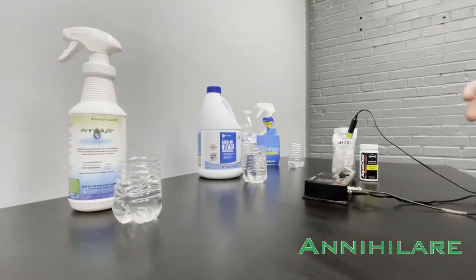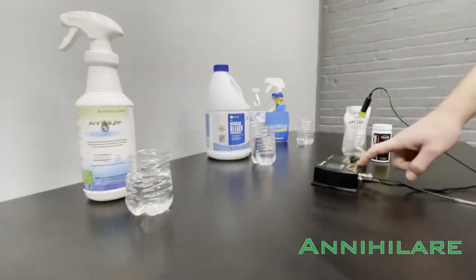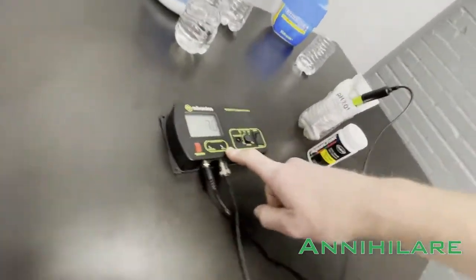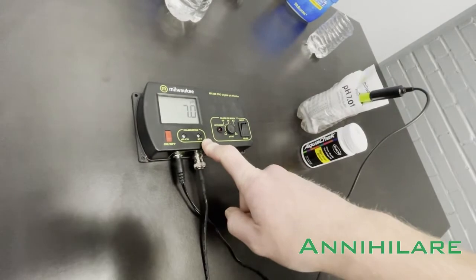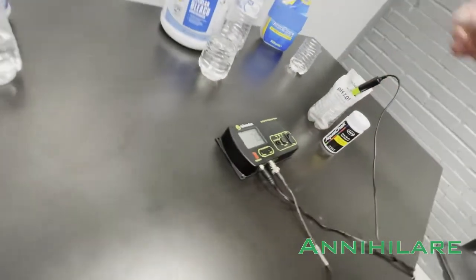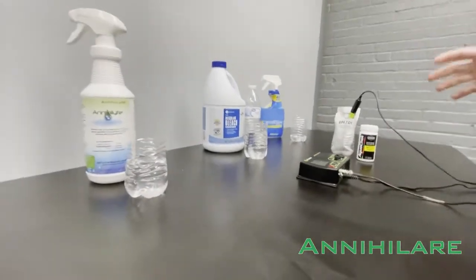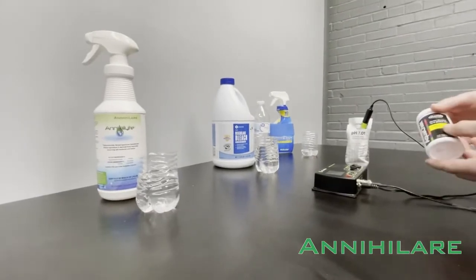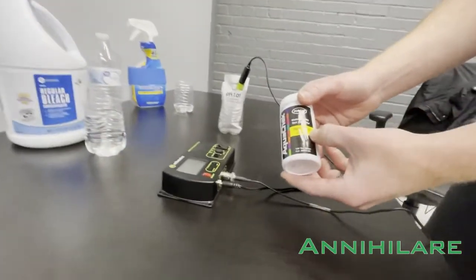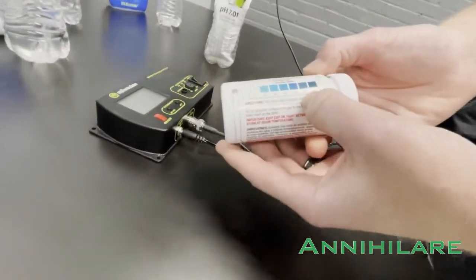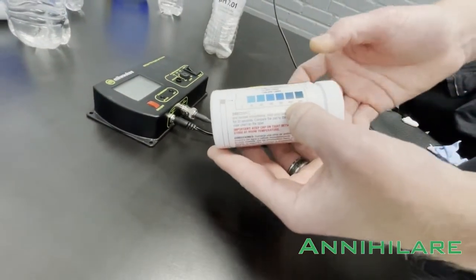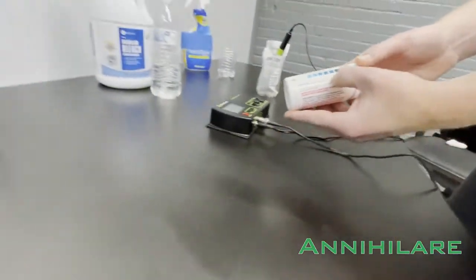The way we're going to show this is with a pH meter which we've calibrated and established a baseline at 7.0 using this buffer solution. The parts per million is going to be measured with these high range chlorine test strips that have a color pattern here that will tell us roughly what our parts per million will be.